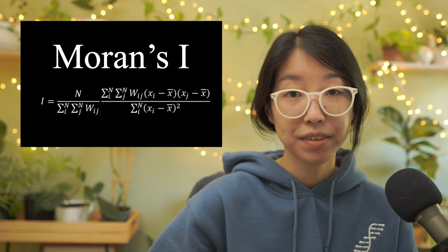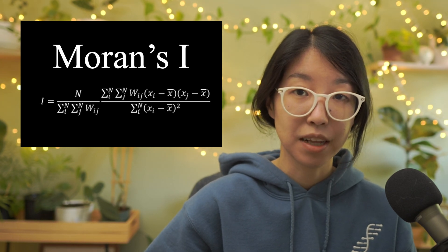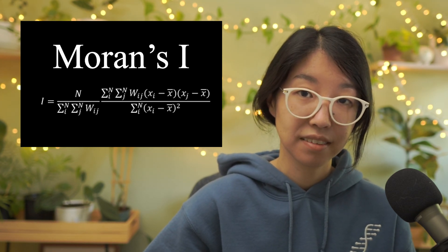Specifically, we'll learn about Moran's I, a statistic originally developed in the context of geospatial information sciences.